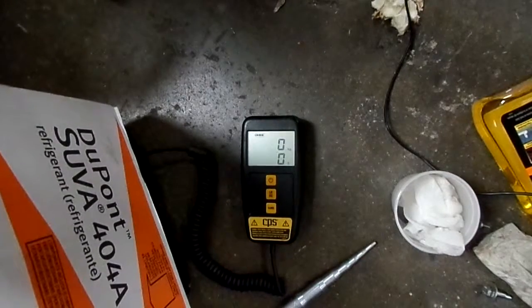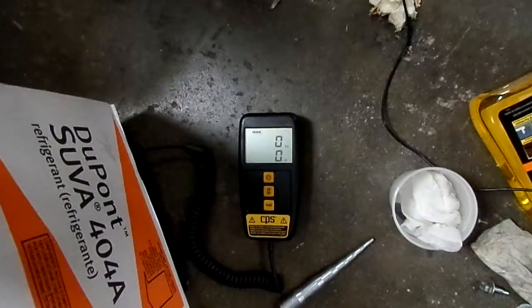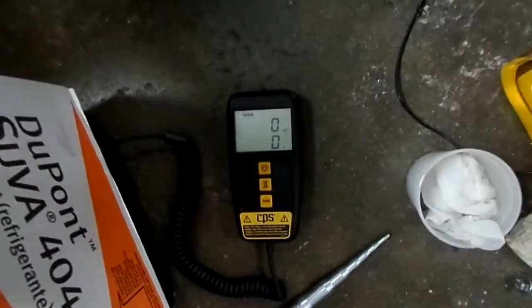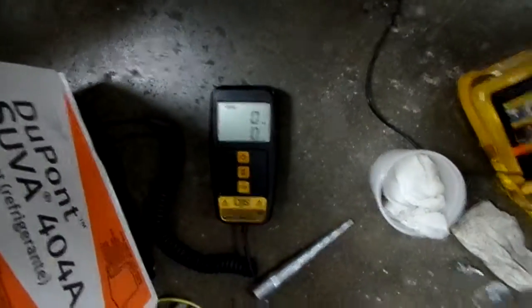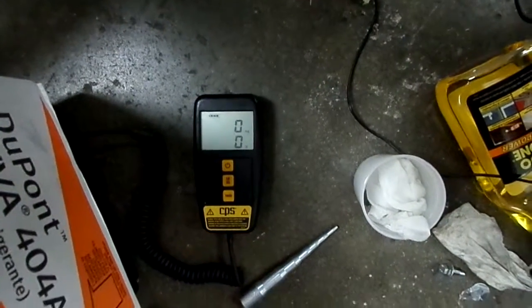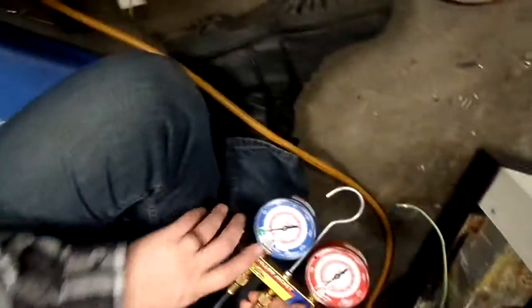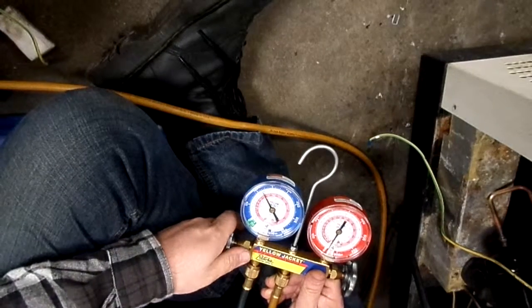Tare resets it to 0. And you can see it's on grams and kilograms. Metric. Alright, so it seems to be settled down. It is 0. I'm just going to hit tare once for just good measure. And then you always charge from the low side, the suction side. The machine's off. We're just going to throw a good solid 300 in it.